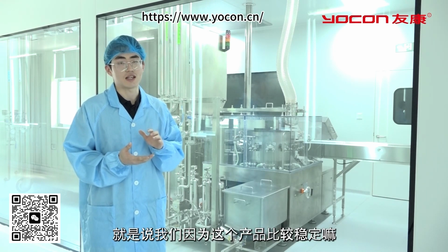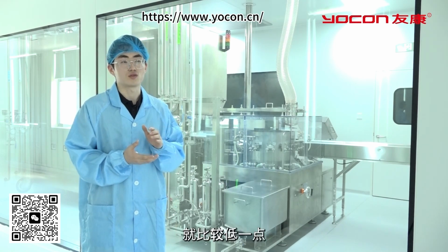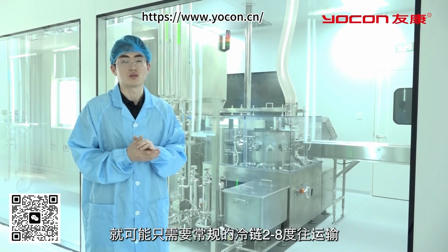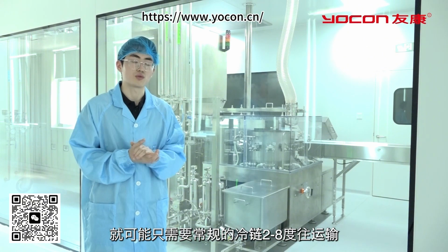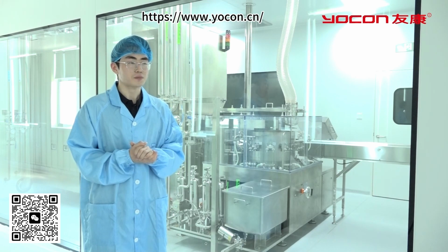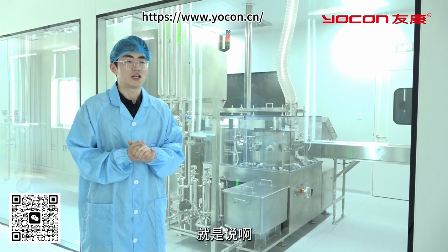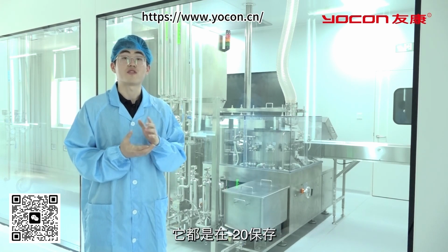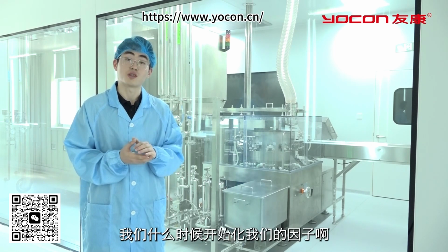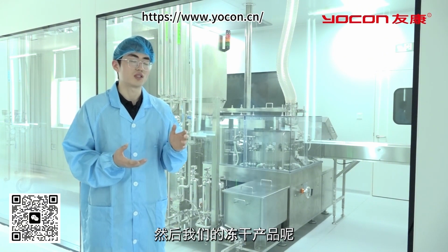facilitating long-term product preservation. Thirdly, due to the stable nature of freeze-dried products, transportation costs and complexities are reduced, with less stringent requirements for transport conditions. Many products require dry ice transportation, but freeze-dried products only need conventional cold chain transportation at 2-8 degrees Celsius, and some can even be transported at room temperature, saving on shipping costs. Lastly, freeze-dried products are easy to reconstitute, eliminating the need for lengthy melting processes. They dissolve quickly and easily, facilitating convenient operation.